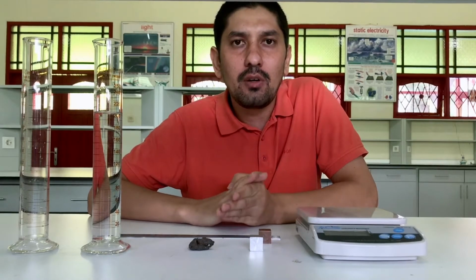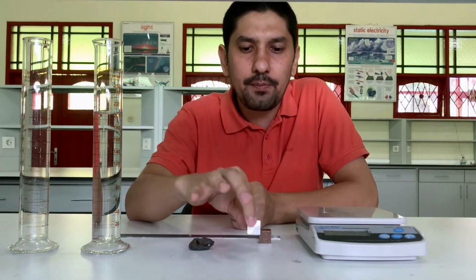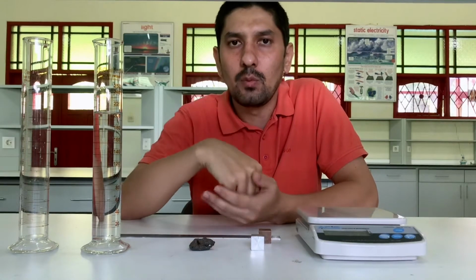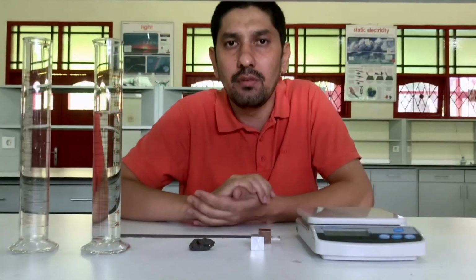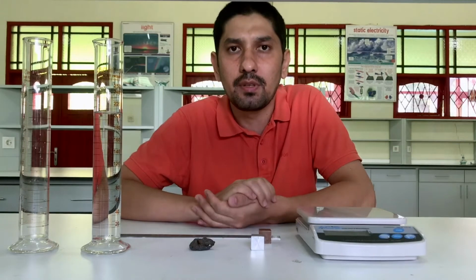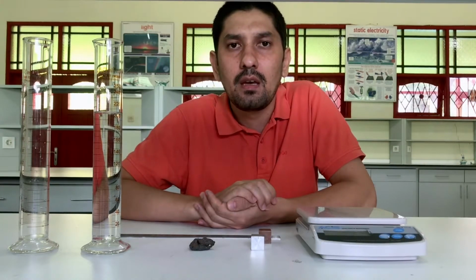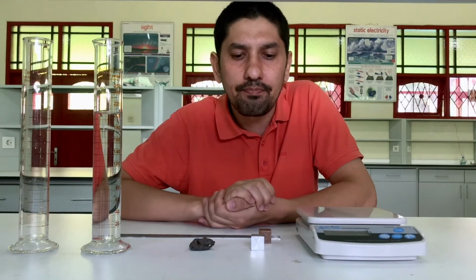In this video, I will be determining the density of a regular shaped object, an irregular shaped object, and water. So first of all, what is density? Density is the amount of matter per given volume. It is a property of substances. It tells us how mass is concentrated.